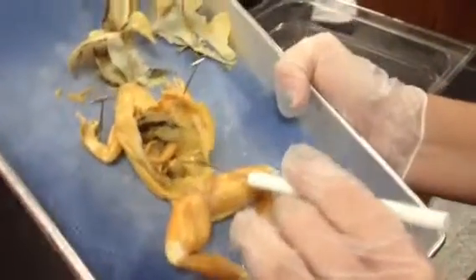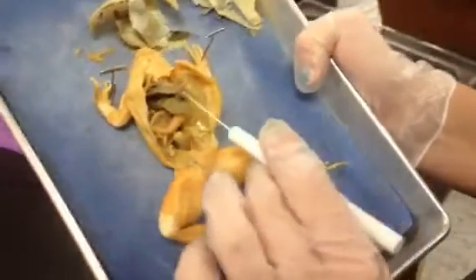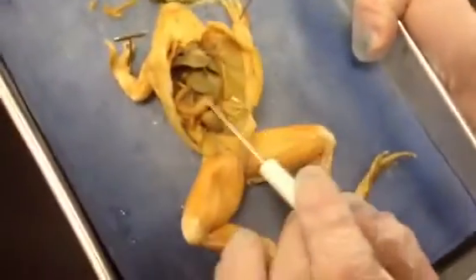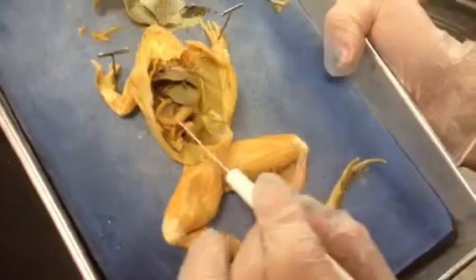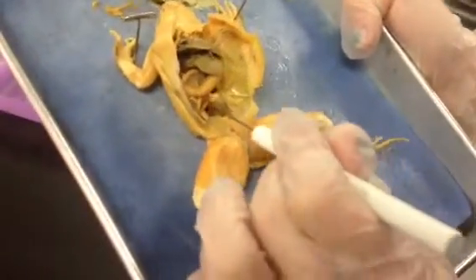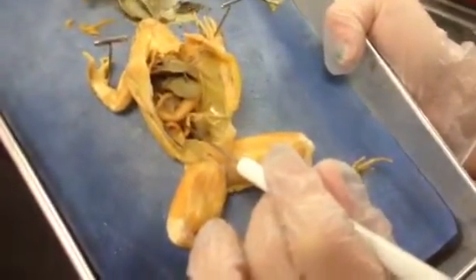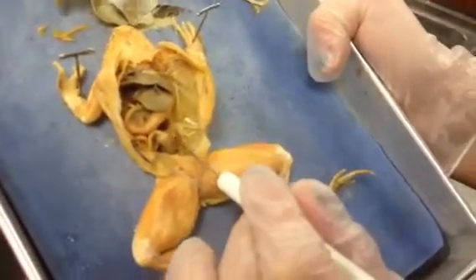The liver is right here, the stomach, the small intestines are right here, and the large intestines.